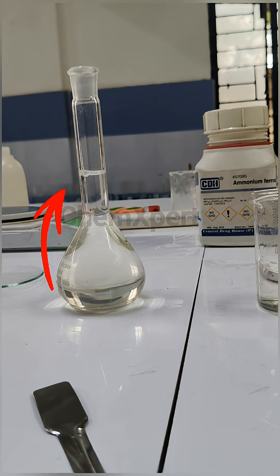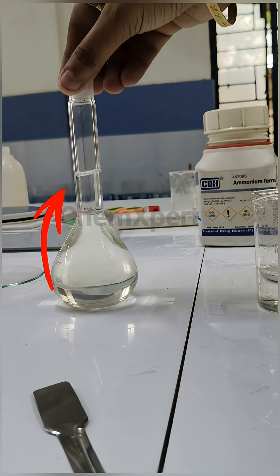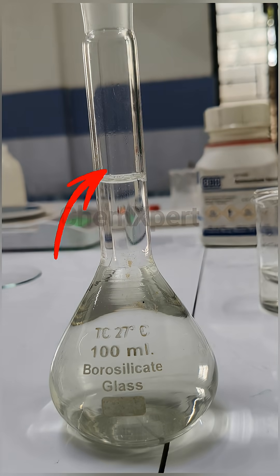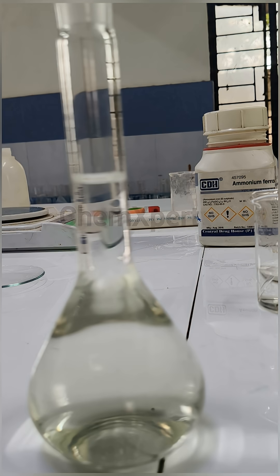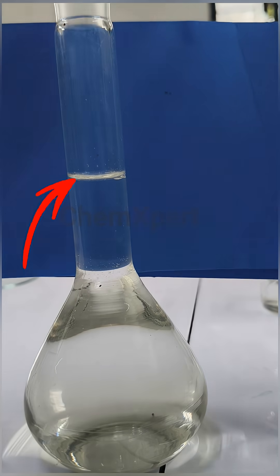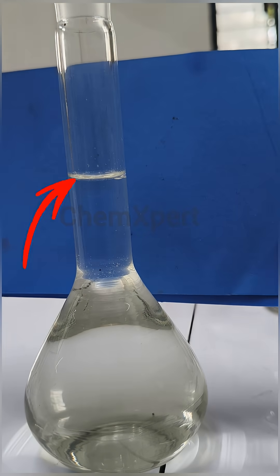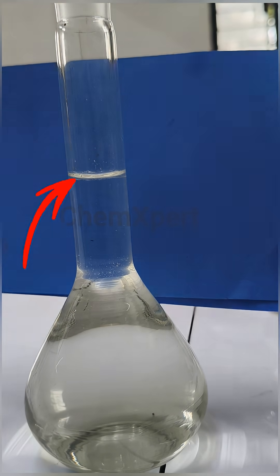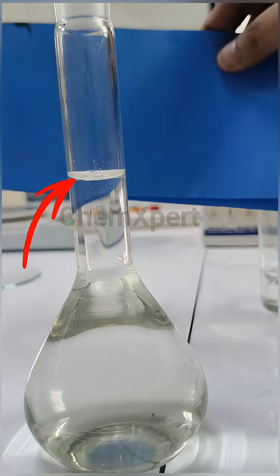Add drop by drop at the end so that its lower meniscus is touching the point. You can observe here the line which I have shown you earlier. Now I will add drop by drop solution so that the lower meniscus of the solution touches that line.